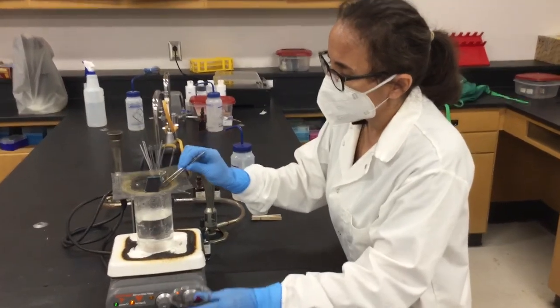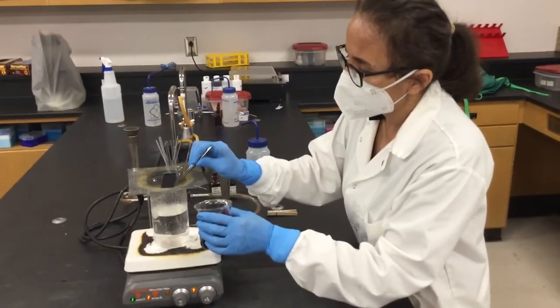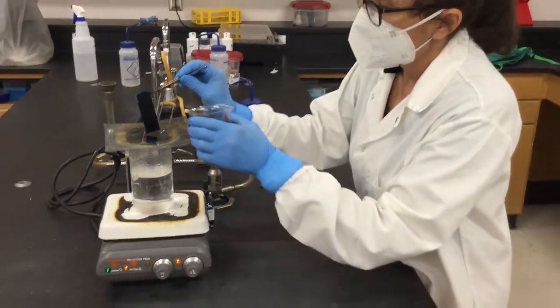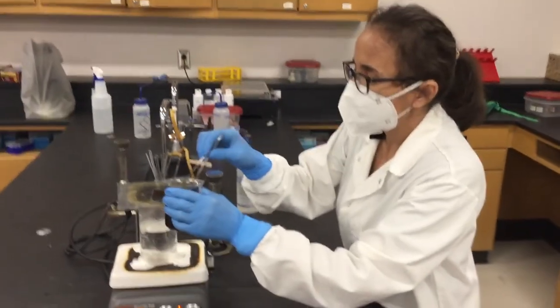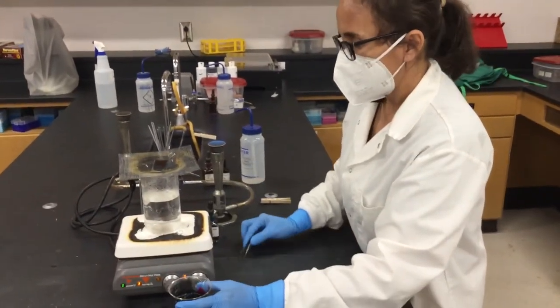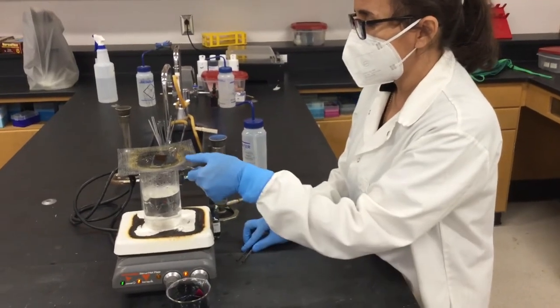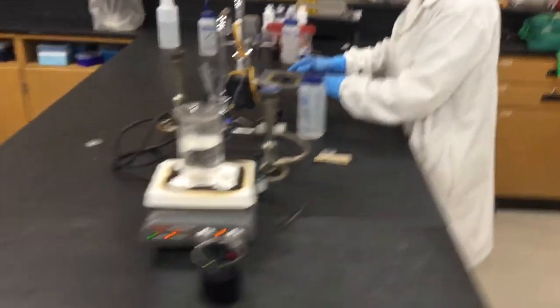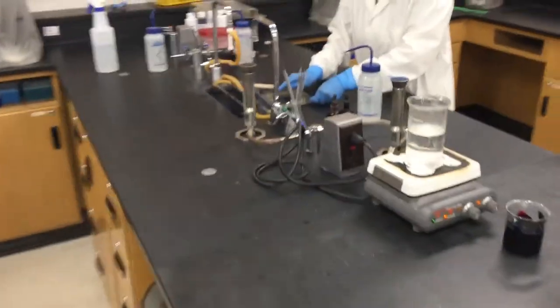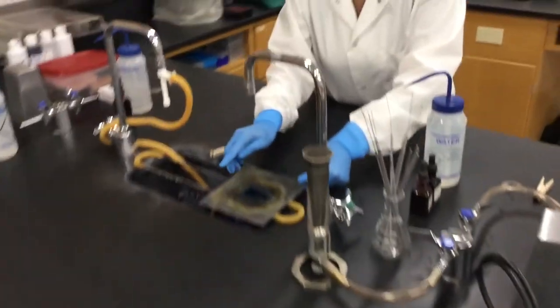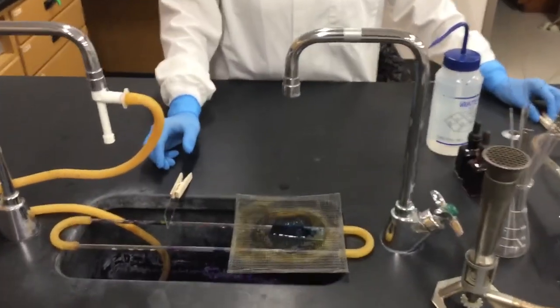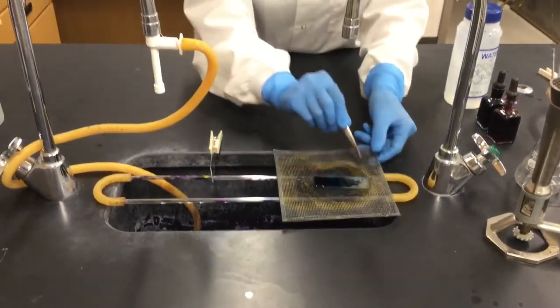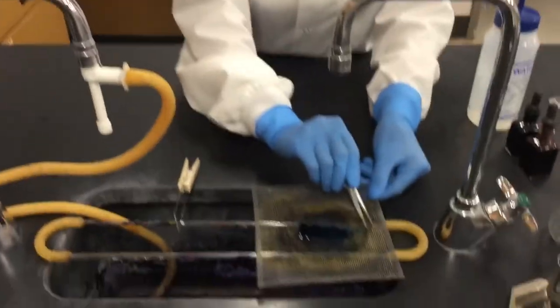So I think this is enough since this is a demonstration. It's almost five minutes. So we will withdraw this, put it into here, and then take this grid, which is not hot, the area where you're going to do the next step, which is rinsing, and then adding the counter stain.